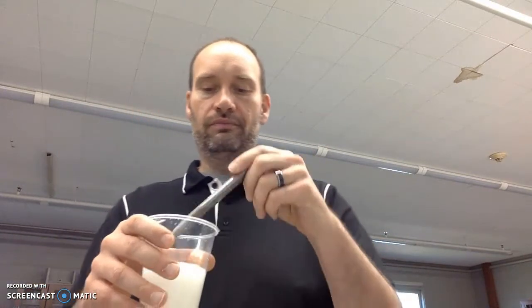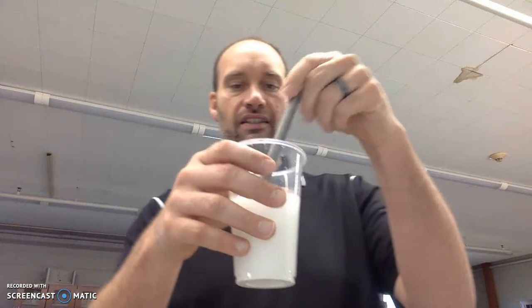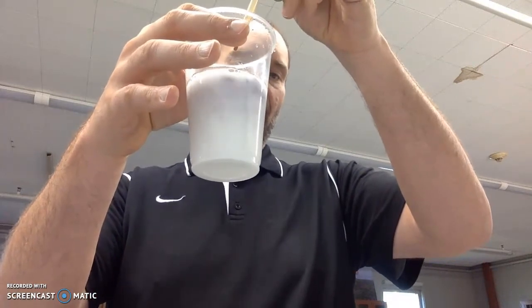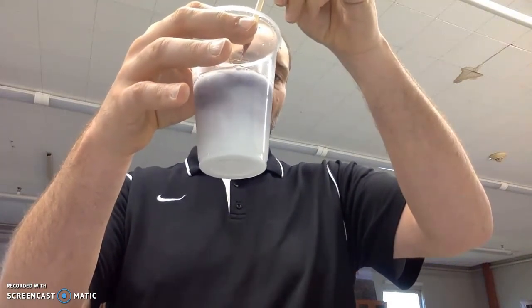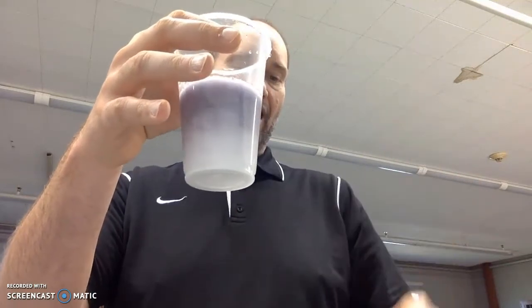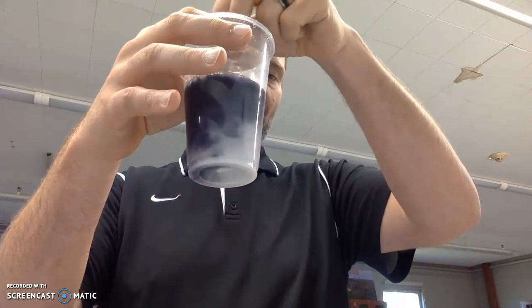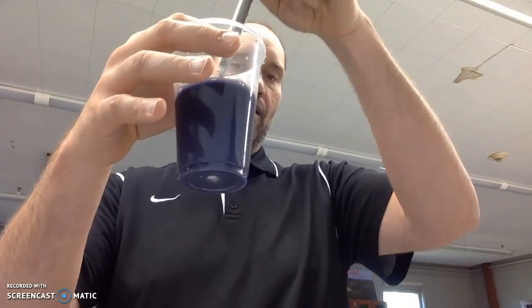All right, so I'm going to mix this up just like this. Now, what I'm going to do with the iodine is put drops in there and we're going to see what happens. How do I know that there's starch present in this? What happens to the color? As you look at that, you can see it starts to change colors from white to purple. And what is that telling me? That's telling me that the iodine is saying, hey, there's starch in here. That's what an indicator is. So iodine is an indicator for starch. It'll change color in the presence of it.